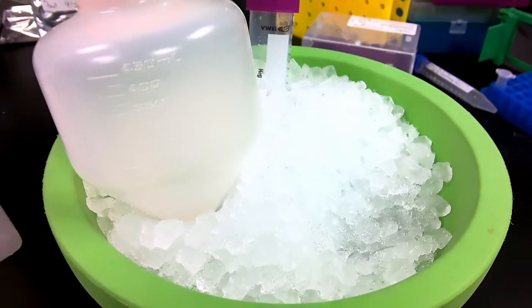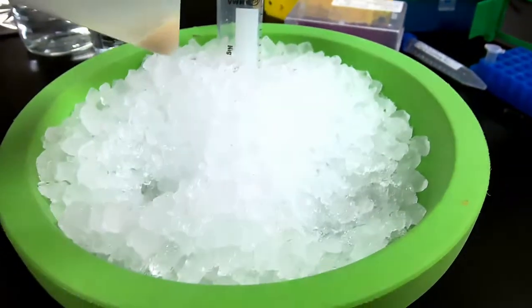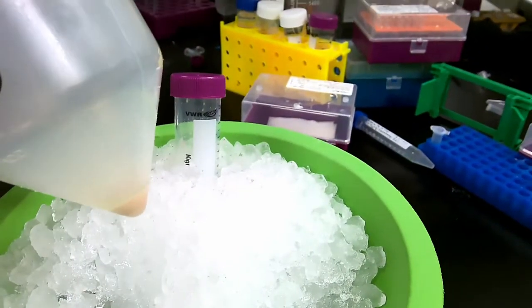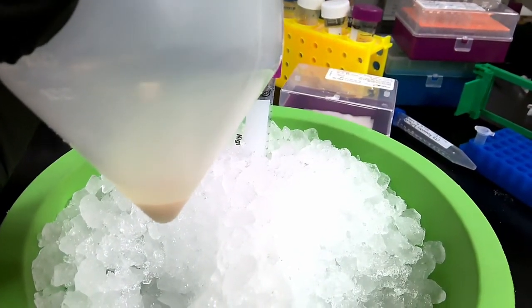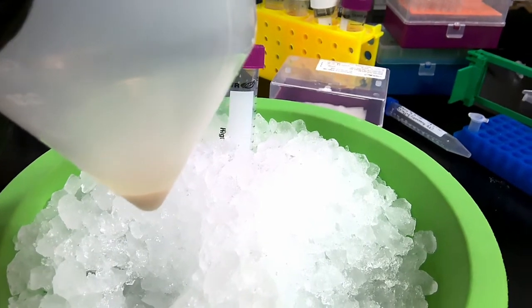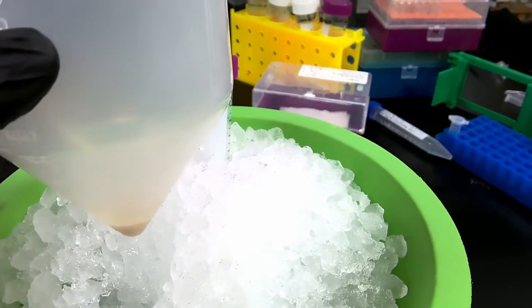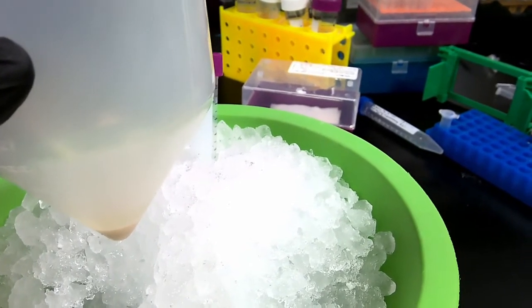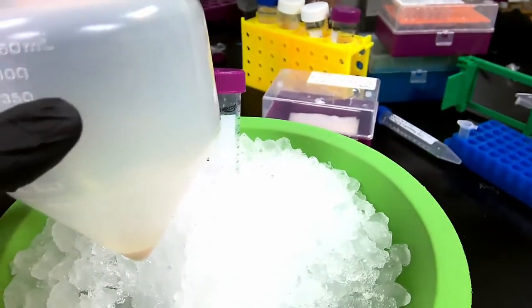All right, so now we finished centrifuging the cells and we're able to get a pellet. Here you can see one of the pellets that we got, and each of these pellets weighed about 2.5 grams. So to each of the pellets, I added about 3 mLs per gram, so altogether 7.5 mLs to each pellet because there were two.